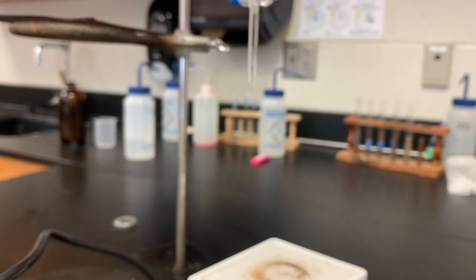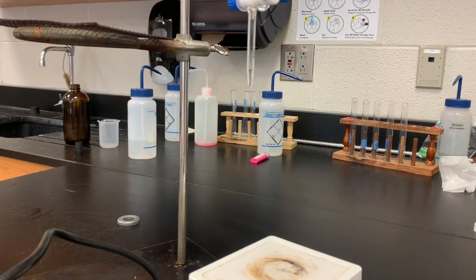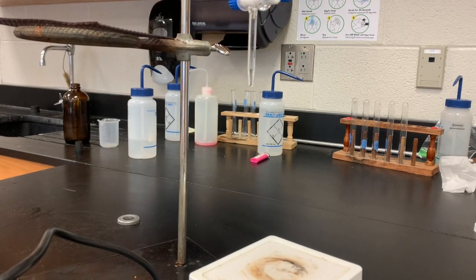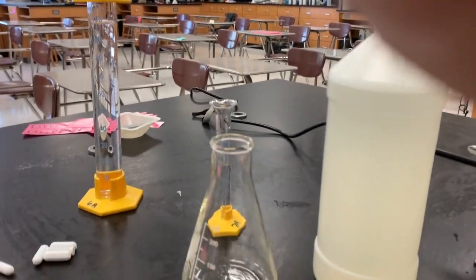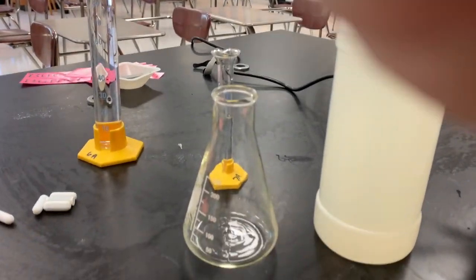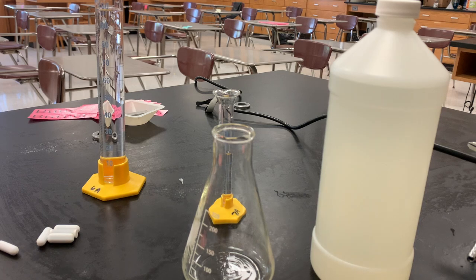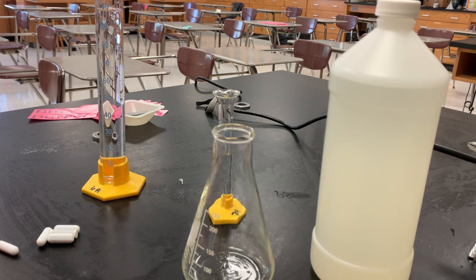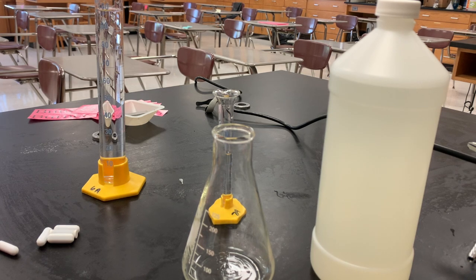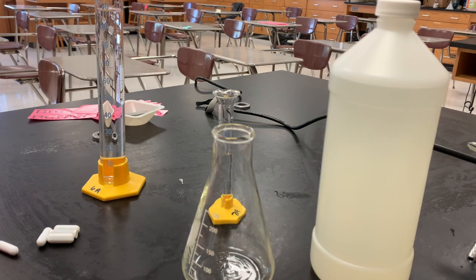So we are going to say we have 50 mL of NaOH as our starting solution. We may have to add more in, so don't get too picky with that. I'm going to write that down right now and give you the data when we're done.